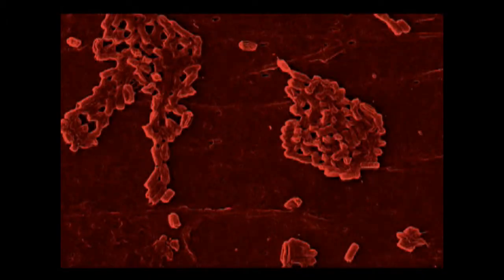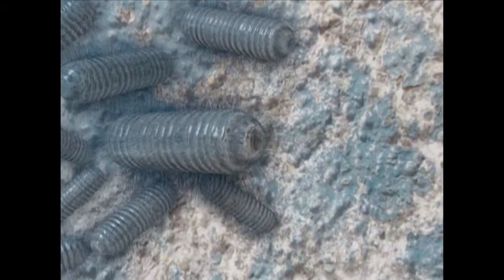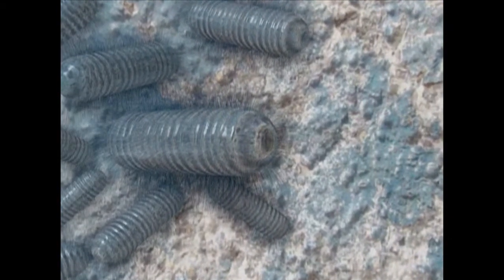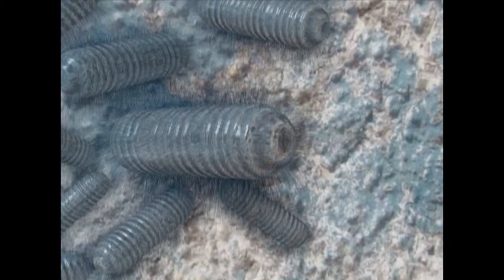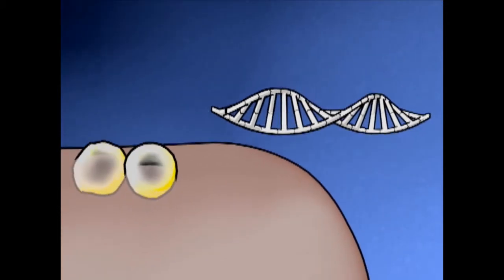Much of the current research in molecular biology involves transformation of Escherichia coli cells. The following experiment will demonstrate the transformation of E. coli cells with the PUC8 plasmid. In order for a cell to accept foreign DNA, it must first be in a state known as competency.